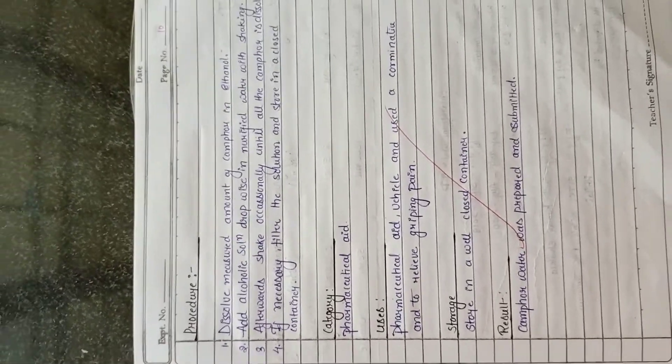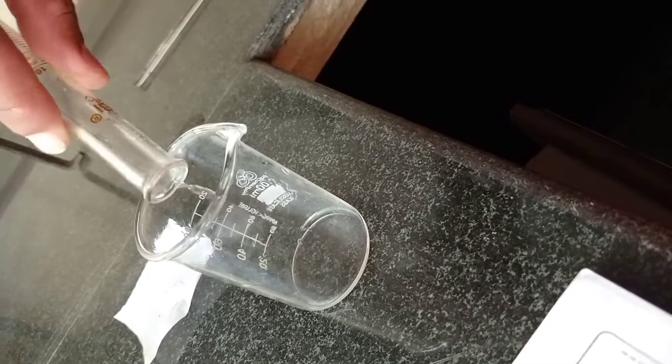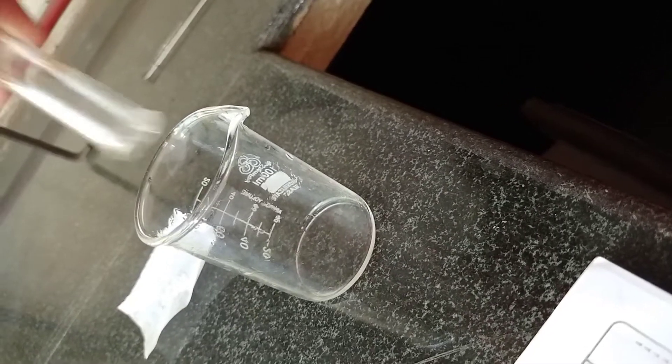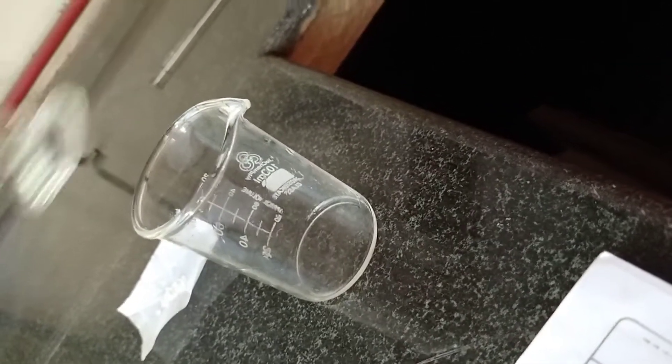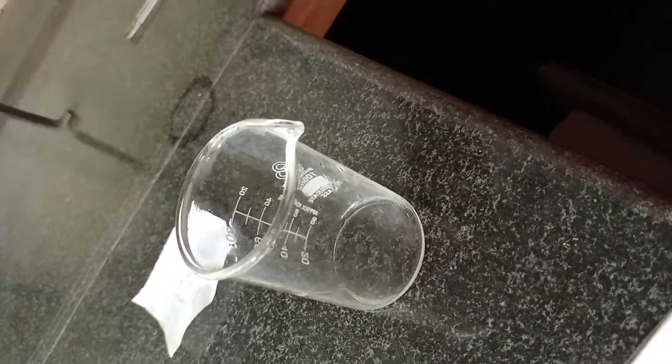Here is the procedure: dissolve measured amount of camphor in ethanol. We are preparing a mixture of camphor and ethanol.